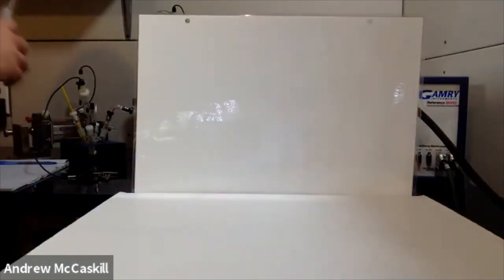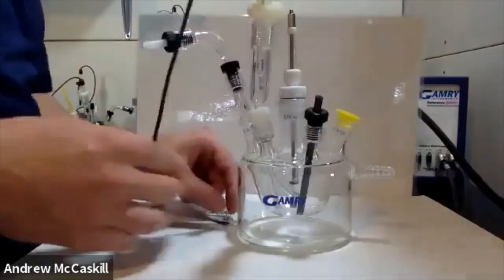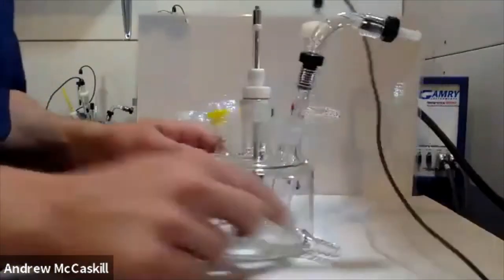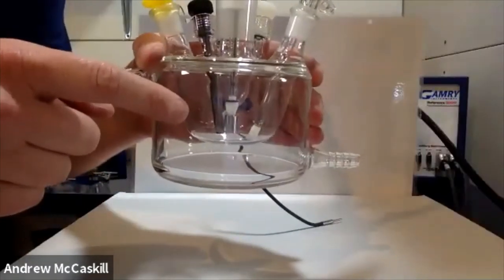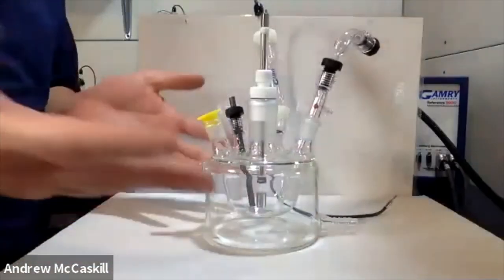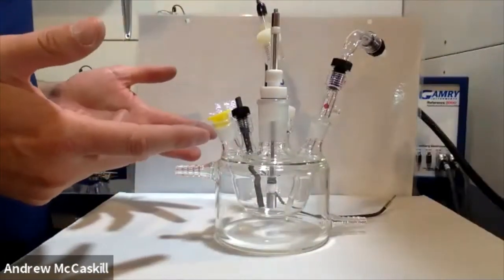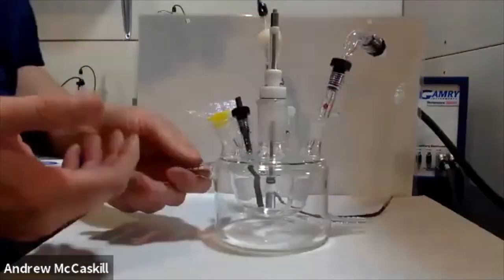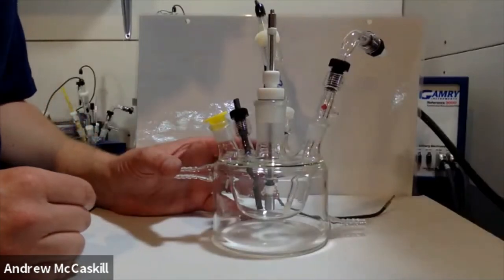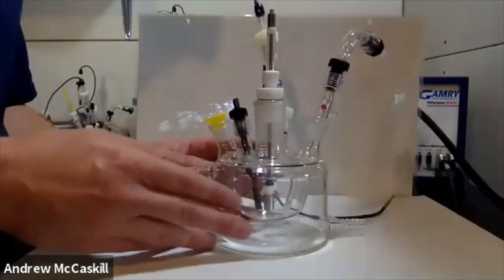The next cell is basically the Dr. Bob with a larger volume, at least initially. This is the Euro Cell, in the jacketed version. There are two barbs on either side so you can introduce a fluid to control the temperature within the cell. The outside jacketed solution is isolated from anything within the cell; you don't need a stand because the jacket also functions as one. This cell handles a larger volume — about 50 to 150 milliliters — and it can also be designed to work with rotator experiments.